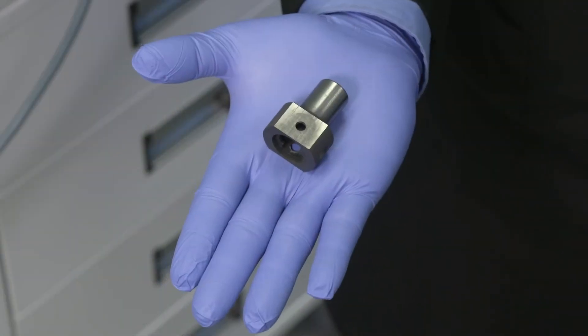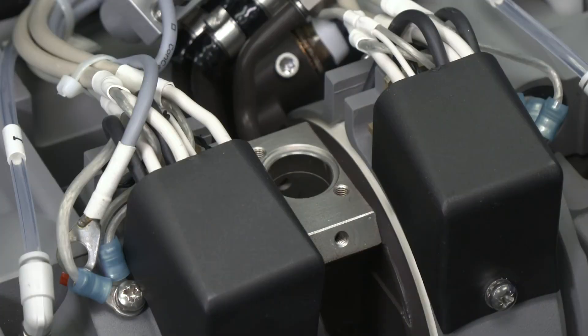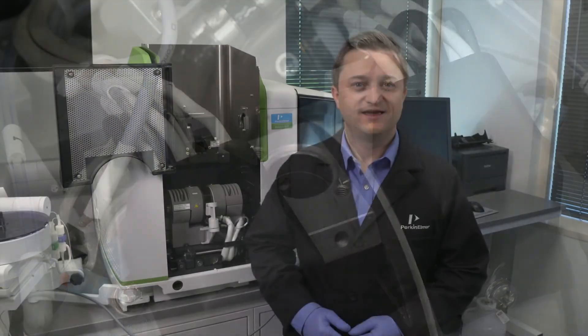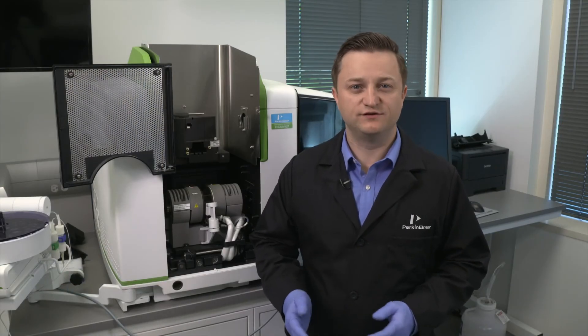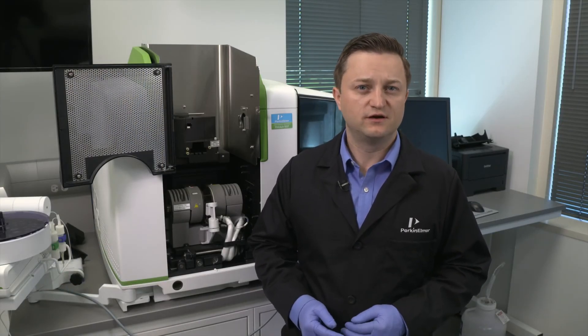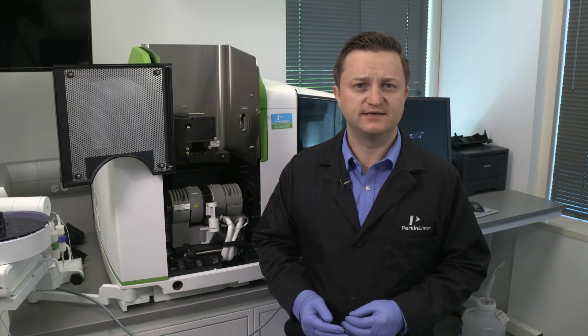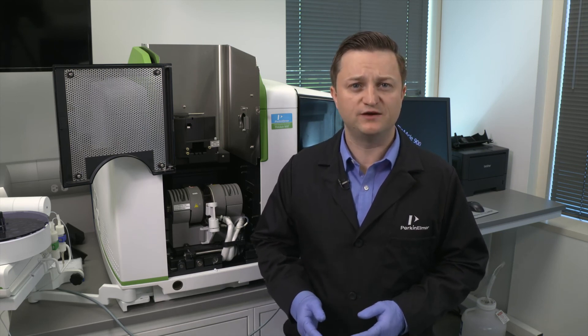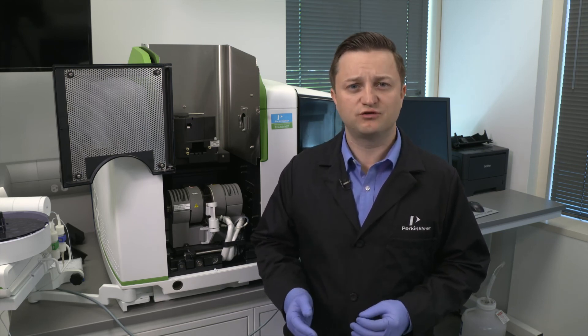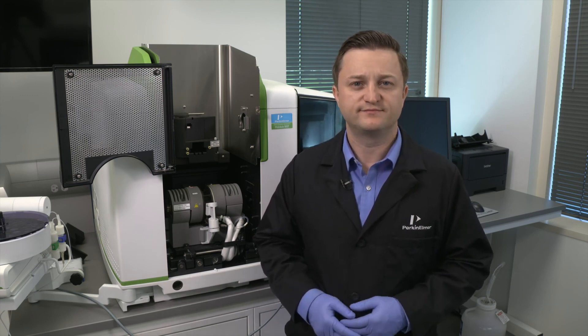Now your contact cylinders can be replaced. Ensure that you clean the contact housing before you reinstall any new contacts. Your manual and these how-to videos are great resources to get familiar with the AA system. For more in-depth information or additional training options, please reach out to your PerkinElmer representative. Thank you.